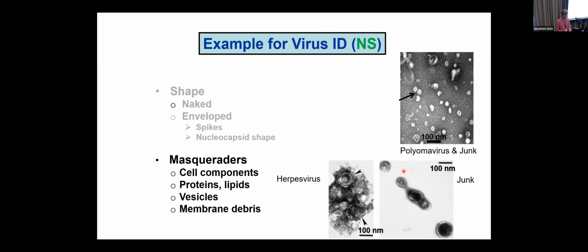Now, how do I know that? There's one particle here that really looks like a virus. How do we know that? You, not knowing any more about virology, if you've never seen a virus before, could tell me that this set of particles is junk as opposed to virus. How could you do that? Look at the mag bar. This mag bar is the same size as this mag bar. What does that tell you? That these two pictures are taken at the same magnification, right?